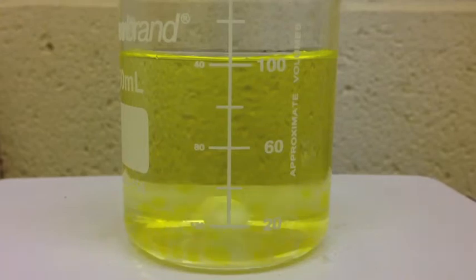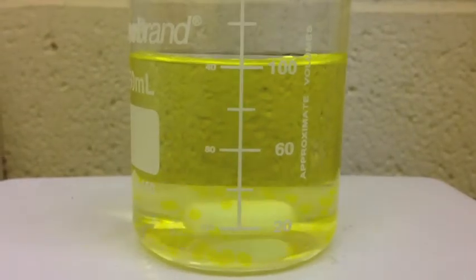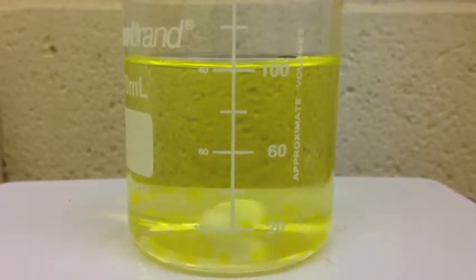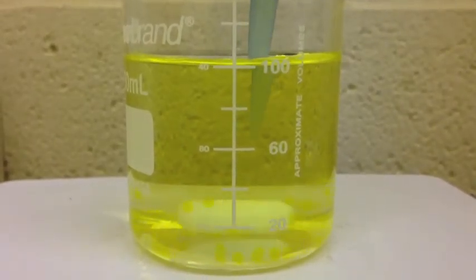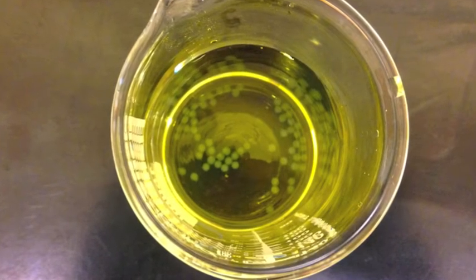For the last half hour, the sample was measured every 10 minutes. After each reading was taken, the sample was poured back into the beaker to keep the sample at a constant volume throughout the experiment. After an hour, the samples were disposed of in an alginate waste container.